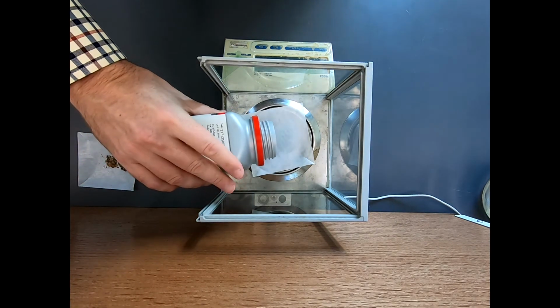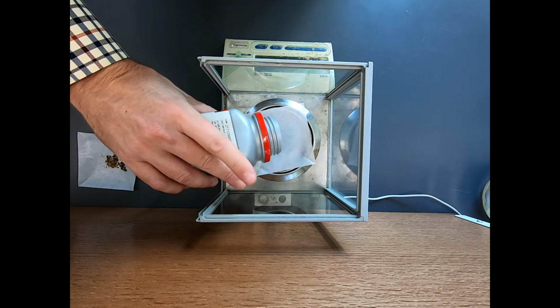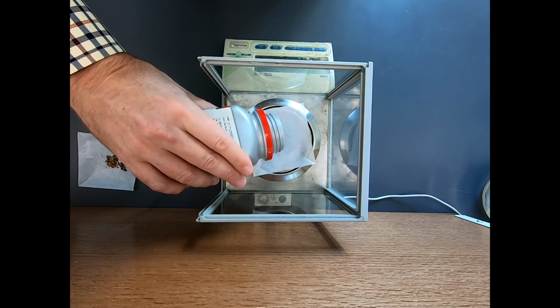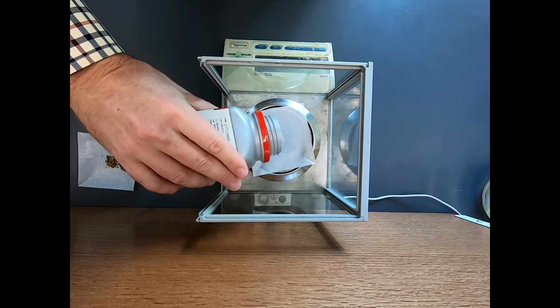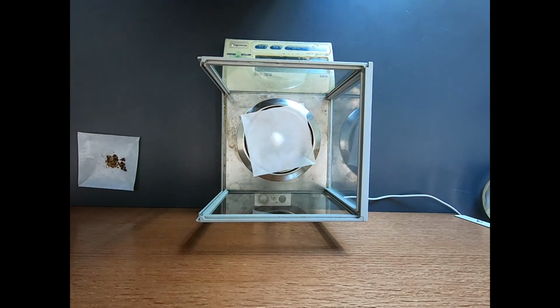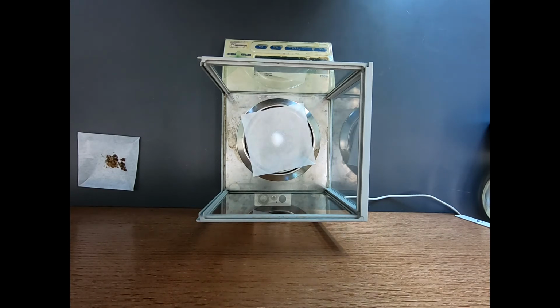I'm not as worried about getting this precise because this reagent is going to be easily washed away when we're done. So if we have a little excess, that's okay. We can rinse this away real easily. So that's 520 milligrams. That's close enough. We just want to be comfortably above 5 millimoles of that reagent. With a molecular weight of 84, we're fine. Okay, so there are our reagents. Let's now go to the hood and start putting these things together.